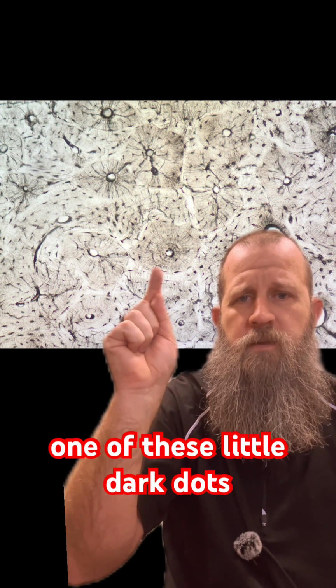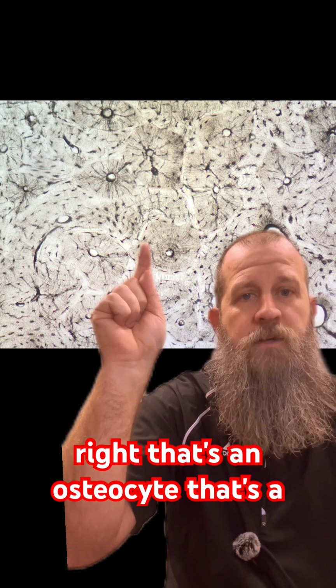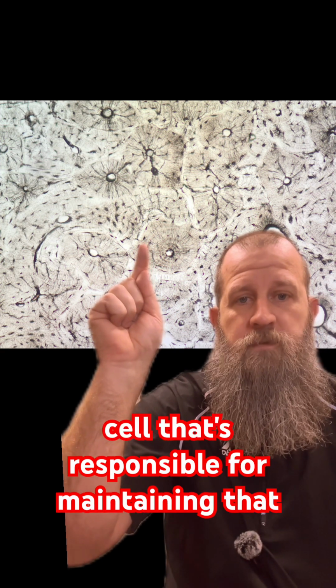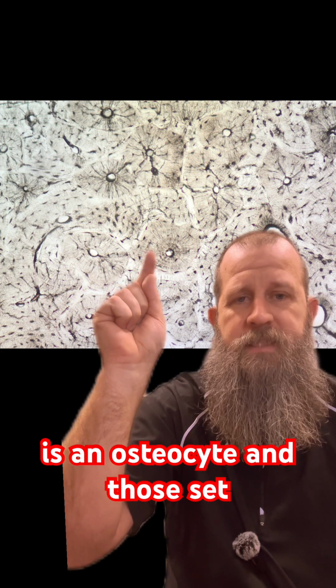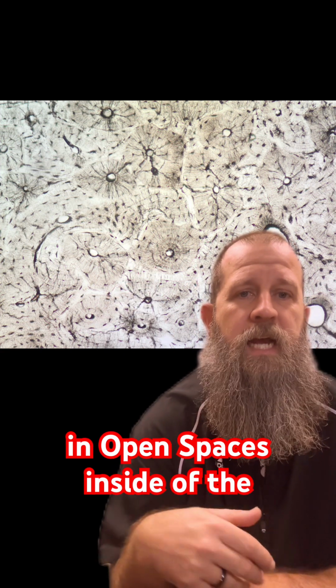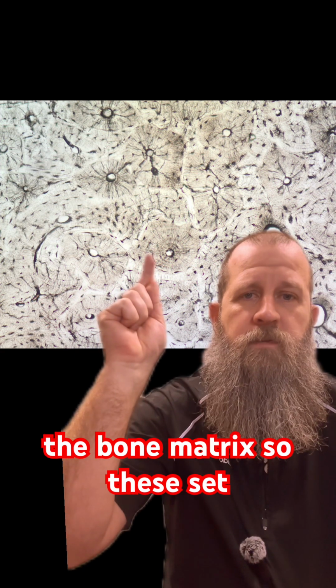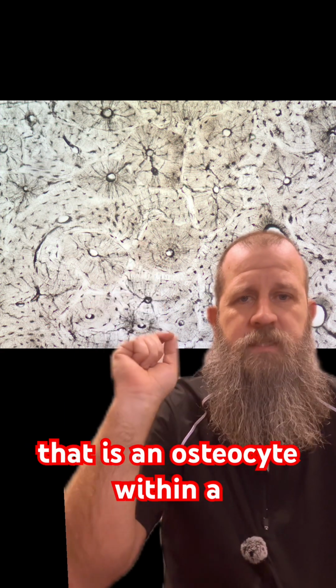Each one of these little dark dots that you're going to see here is an osteocyte. That's a cell responsible for maintaining the extracellular matrix of bone. The osteocytes sit in open spaces inside of the bone matrix, within something we call a lacuna. So that is an osteocyte within a lacuna.